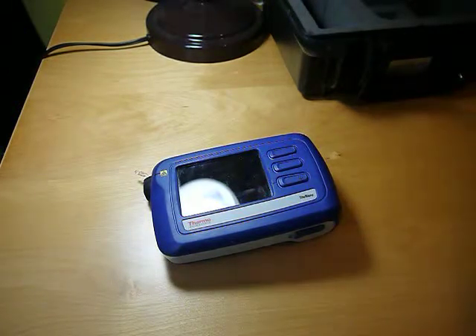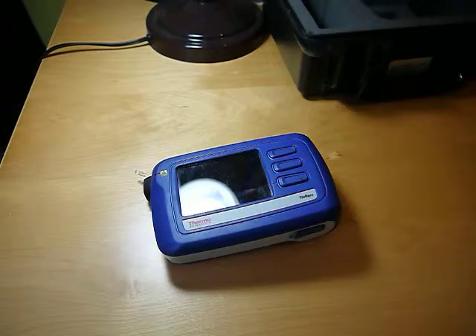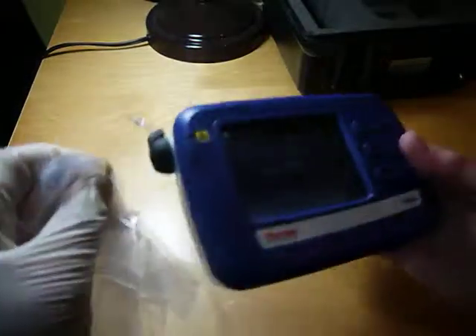To test that, I've actually taken a pill like this and put it into a plastic bag inside of a plastic bag. So I could lay this on the table and beam into it, but I want to make sure that it's making contact with where the laser is coming out.